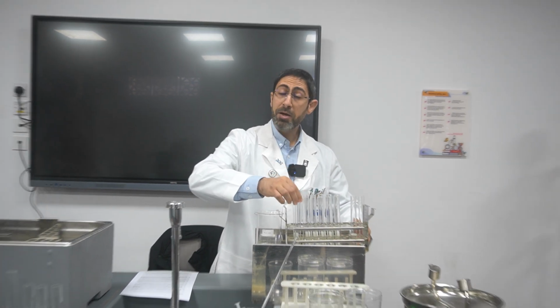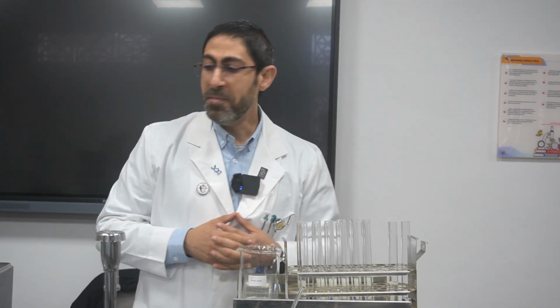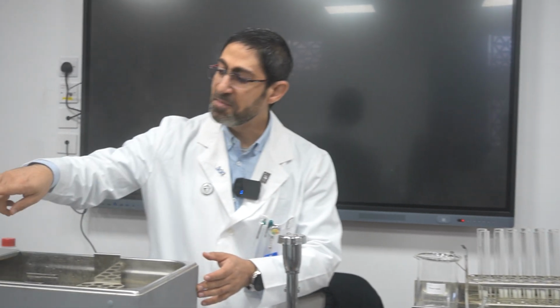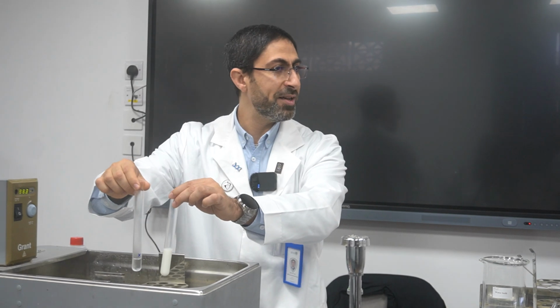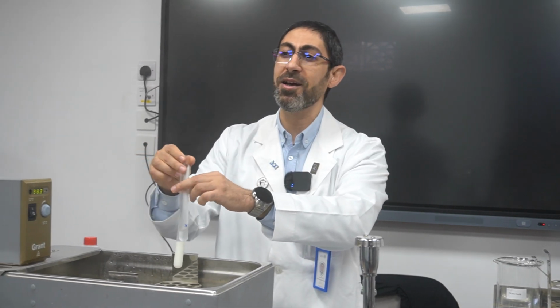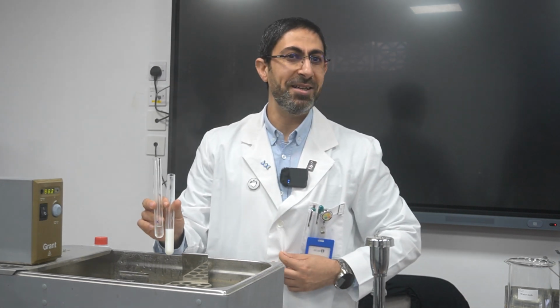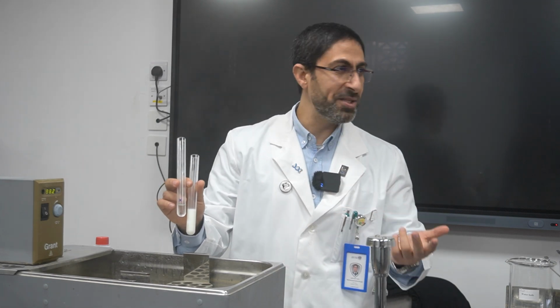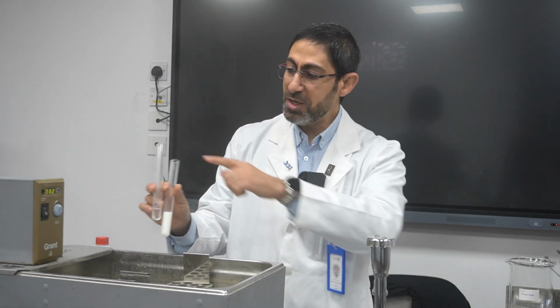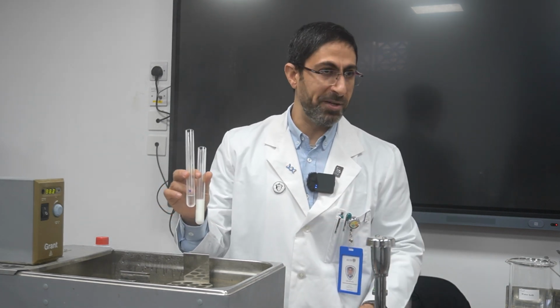But we have many techniques for dealing with the water bath. One of them is to use a thermostatically controlled water bath, adjust the temperature, and place the 2 test tubes in the mobile rack to be sure that the temperature is adjusted properly. I prefer this actually, but it's really time consuming. It will take a lot of time. But now we can do the opposite way, where I adjust the temperature to 100 degrees C. So this is the maximum temperature.